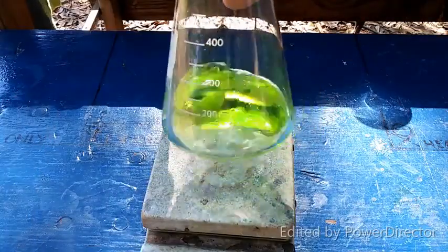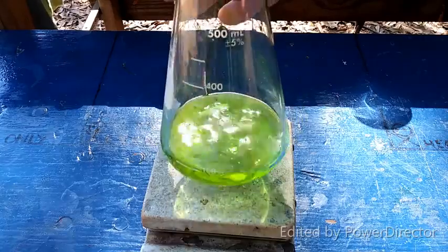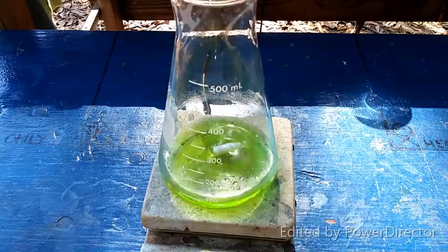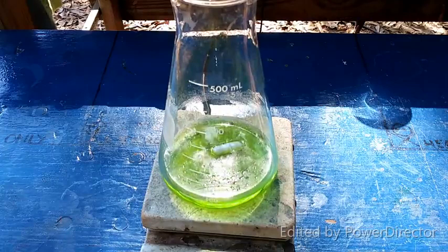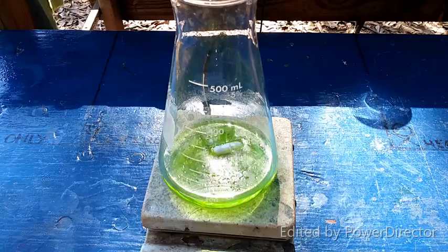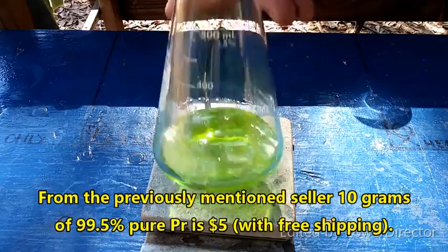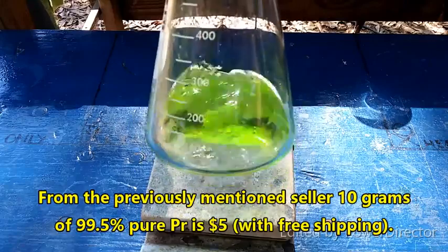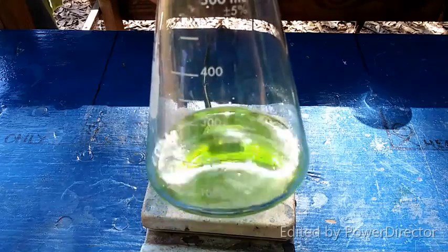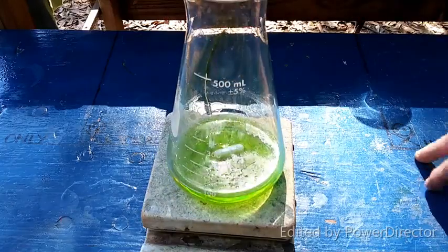All of the praseodymium has dissolved. I also added several grams of praseodymium-3-chloride that I had made a while back — might as well go ahead and convert it all to the oxide. You can buy 5 or 10 grams of this for about 5 or 10 bucks, so it's not expensive at all. It has an absolutely beautiful emerald green color, and just about all aqueous solutions of any soluble praseodymium salt have this color.